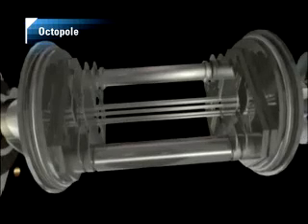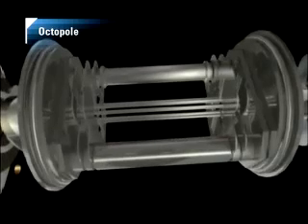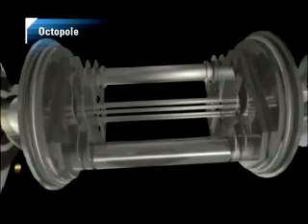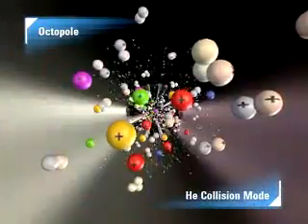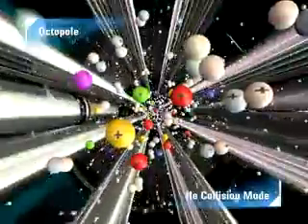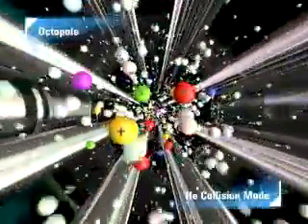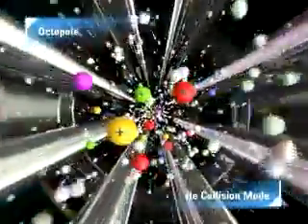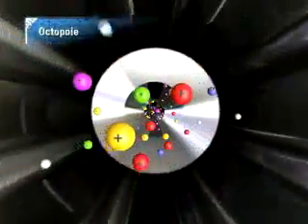This results in more ion-gas collisions and greater interference removal efficiency, which also enables the ORS to operate in collision mode using pure helium collision gas. The larger polyatomic interferences collide more often with the helium atoms than the analyte ions and lose more kinetic energy. A potential barrier at the cell exit allows only the higher energy analyte ions to pass through to the mass analyzer. The low energy polyatomic ions are prevented from leaving the cell by energy discrimination.